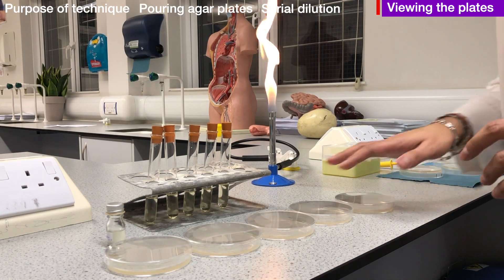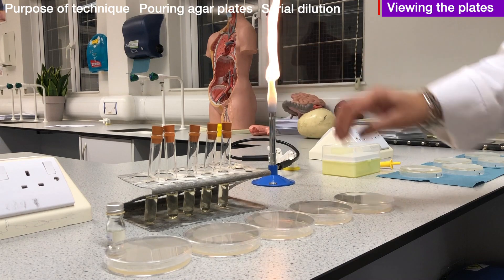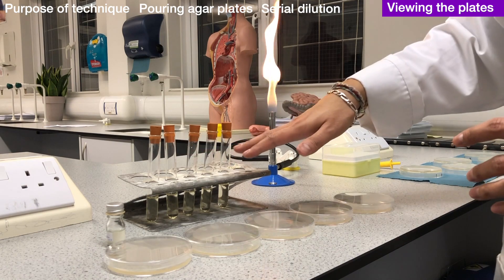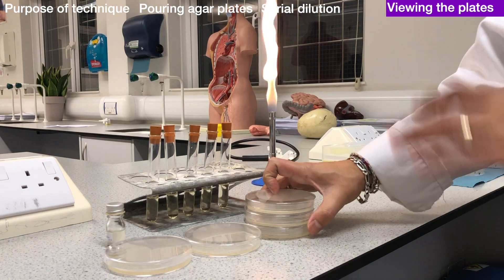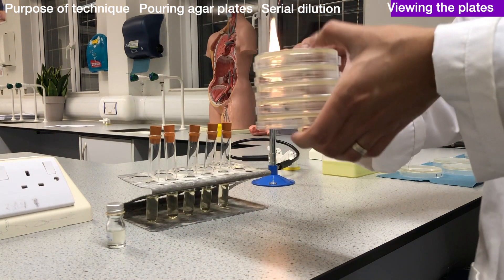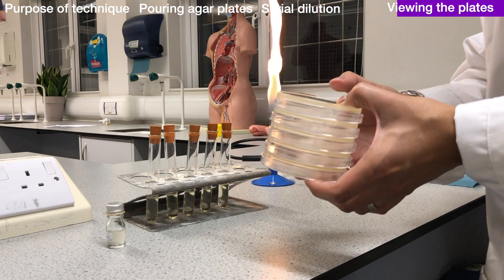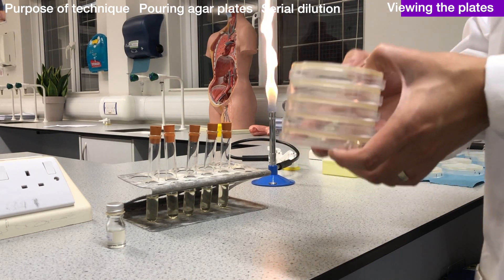At this point I have spread each serial dilution onto a different agar plate. I know exactly how much of each dilution I have put onto the plate. I would give each plate a few minutes for the bacteria to settle down into the agar, then turn them upside down and put them into an incubator at around 20°C. Give them 24 hours and check the plates for colonies. If colonies are not visible by 24 hours, give them another 24 hours — but they should be visible by that time.